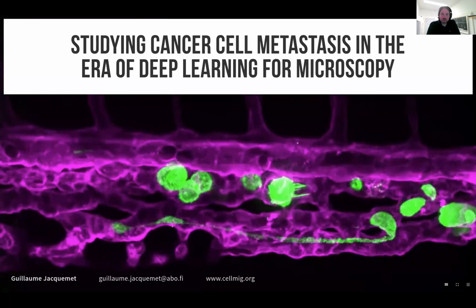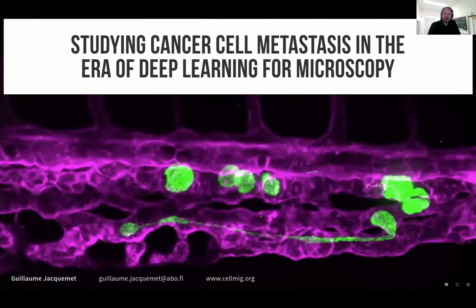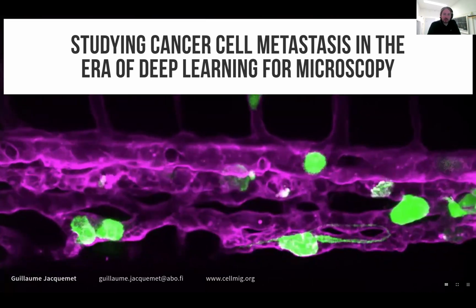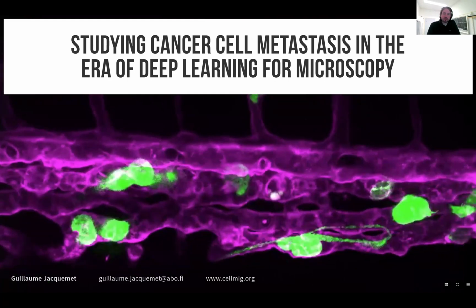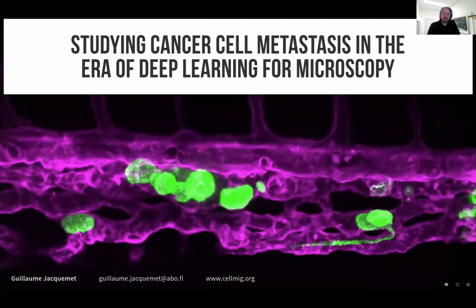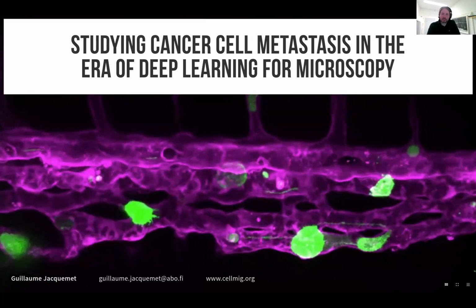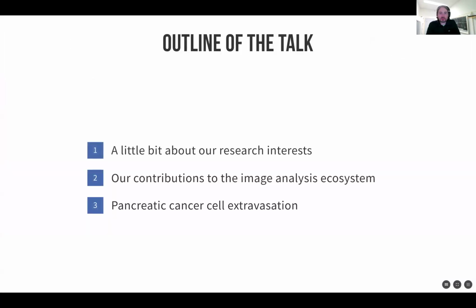So as Rob introduced, I'm a group leader in Turku, Finland at Åbo Akademi University. And today I will be telling you a little bit about some of the work we've been doing, a little bit related to some of the microscopy tools we've been developing and how we've been using them to study cancer cell metastasis. So this is the outline of my talk.